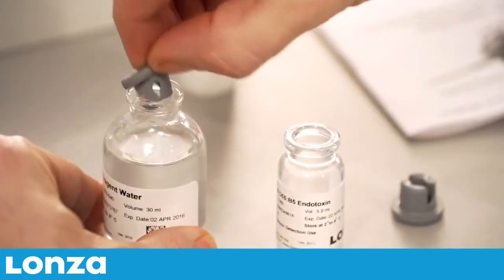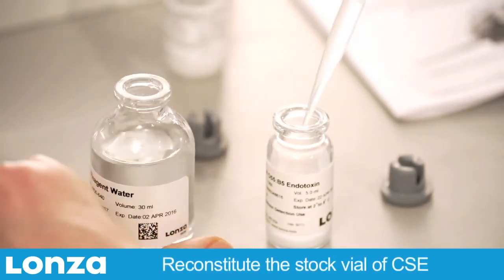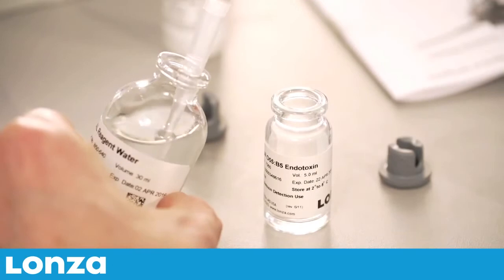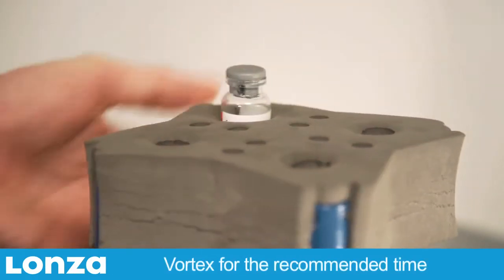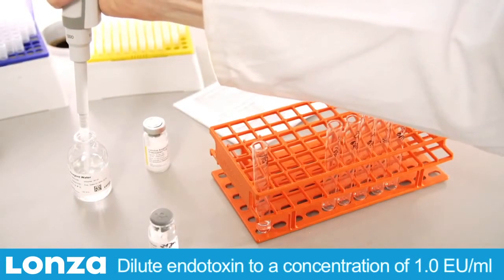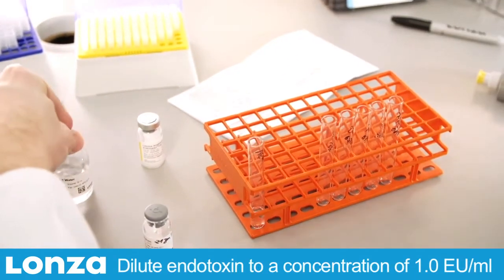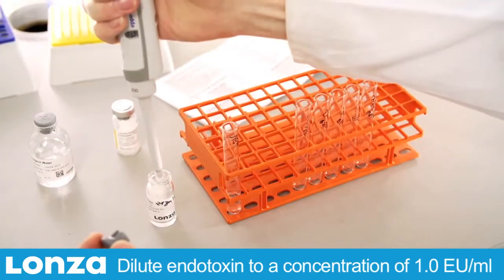Begin by allowing reagents to equilibrate to room temperature. Next, reconstitute the vial of control standard endotoxin with 5 ml of LAL reagent water, then vortex. Dilute endotoxin with LAL reagent water to a concentration of 1 EU per ml using the endotoxin potency identified on the certificate of analysis.